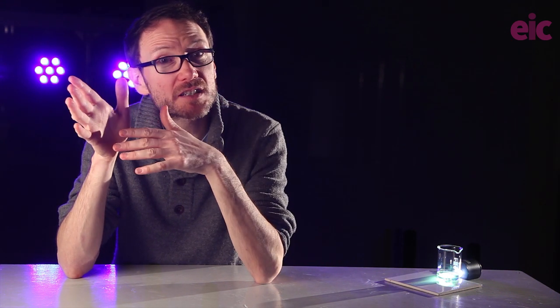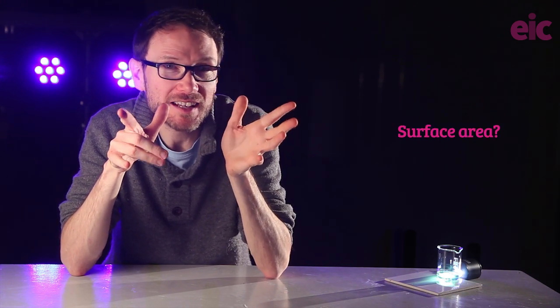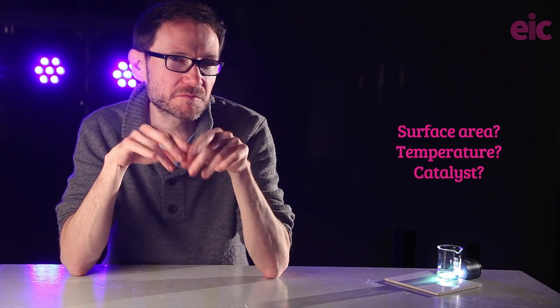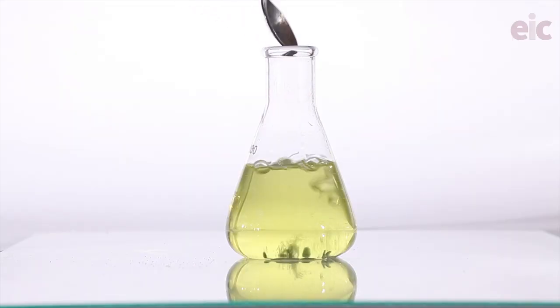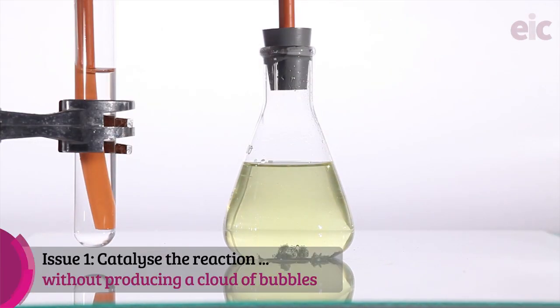It's not ideal for a typical lesson unless you have extended blocks of time to use. So how to speed things up? Well, basic understanding of kinetics tells us maybe we increase surface area by adding some powder, increase the temperature, or add a catalyst. And we had a bit of a clue to this in the last clip there. CLEAPSS suggests adding a few drops of copper sulfate into the solution for the latter of these, catalyzing.